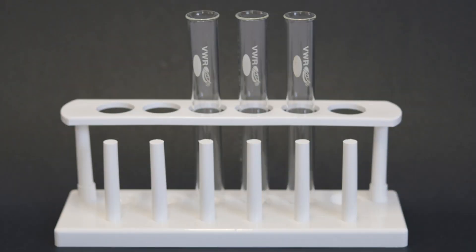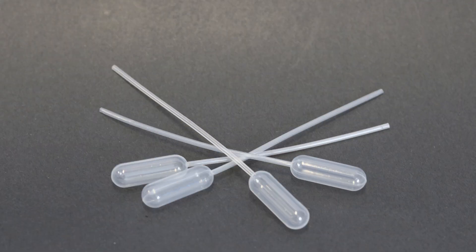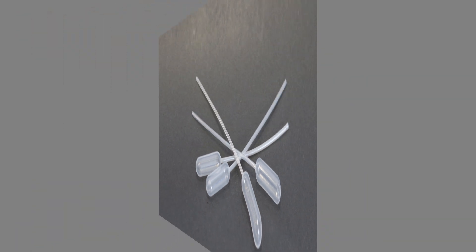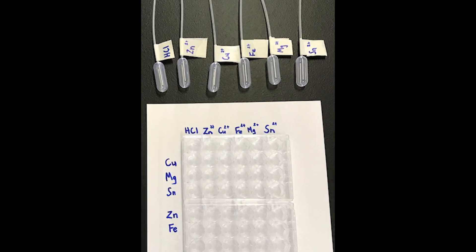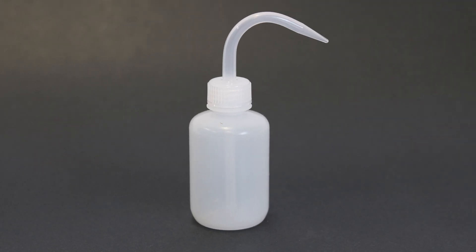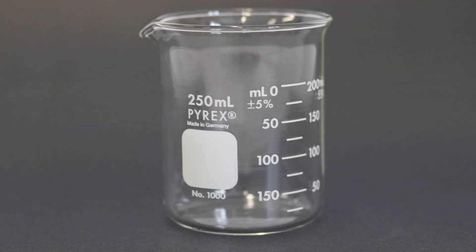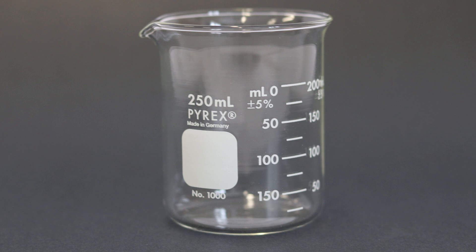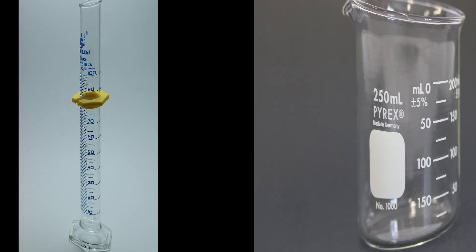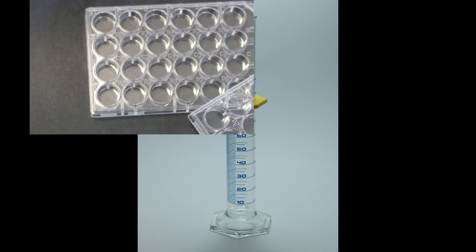Let's take a look at the materials needed for this lab. Test tubes held in place by a test tube rack. Pipettes for transferring solution from the test tubes to the well plate. Make sure both the pipettes and test tubes are clearly labeled so the proper solution goes into the right well. A wash bottle containing deionized water for making solutions. A beaker for making solutions from stock bottles. A graduated cylinder for making solutions. This was completed in a previous video.